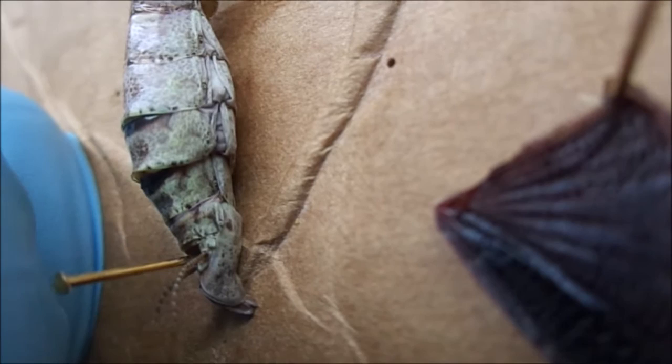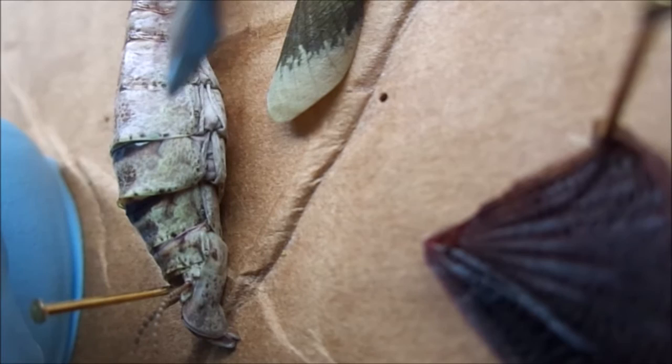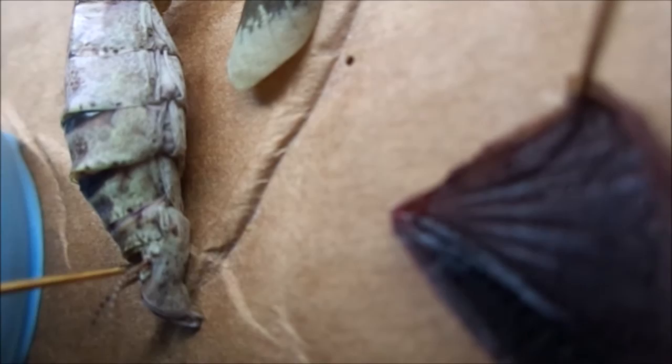If we take a look down here, along here you can see the little line between the upper and lower segments — that is where the insect's breathing holes are. They're called spiracles, and that's where I said leads into the tracheal system.